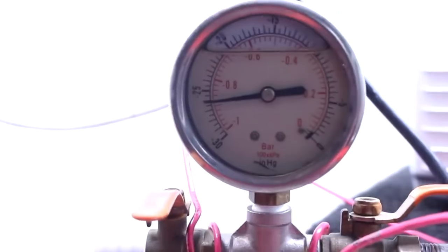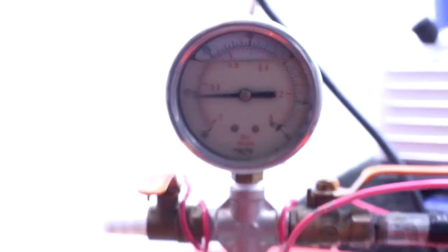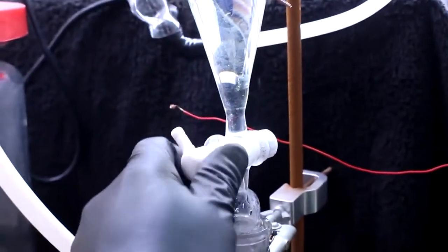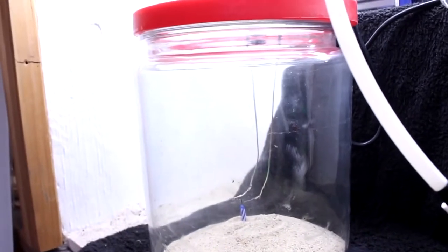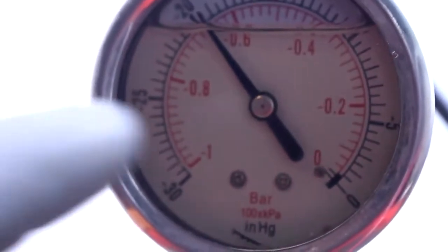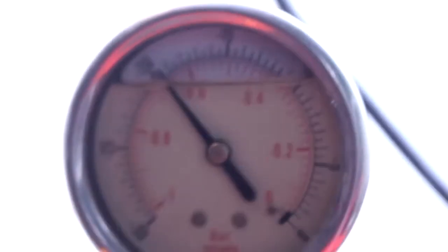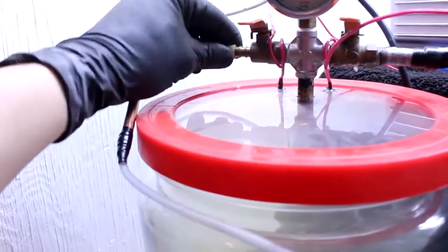You should be able to see the pressure slowly increasing. It's definitely going up — slowly producing chlorine. You should see the jar become kind of a greenish-yellow color. Okay, so there's our chlorine — we've added about six inches of mercury worth of chlorine gas.